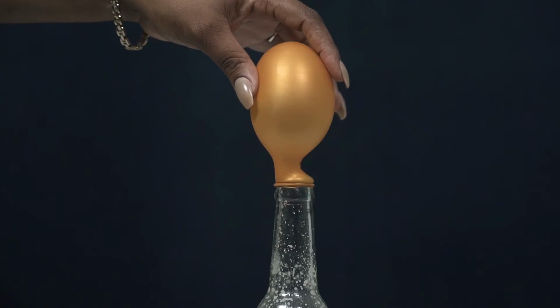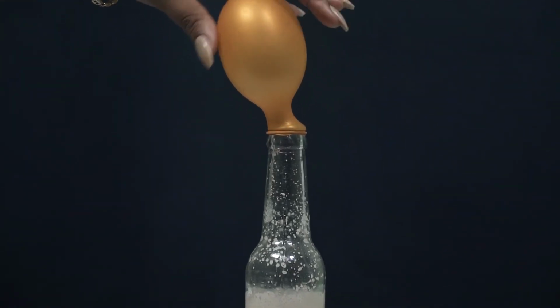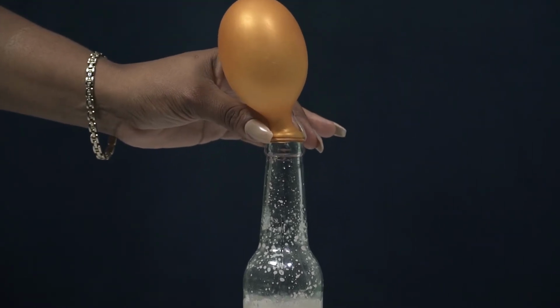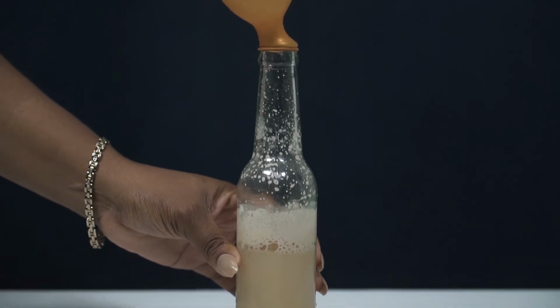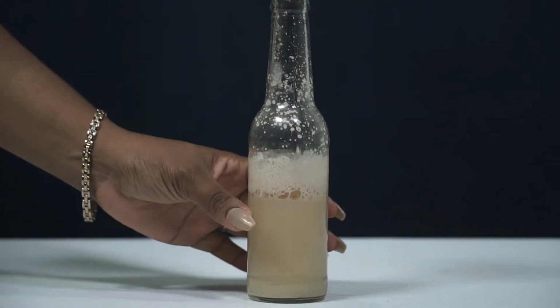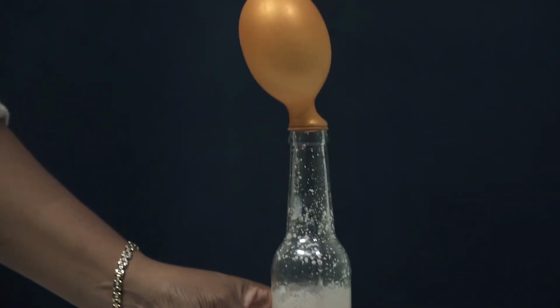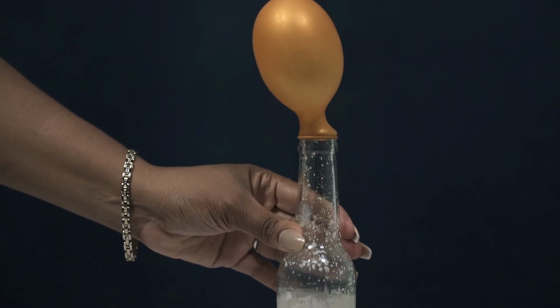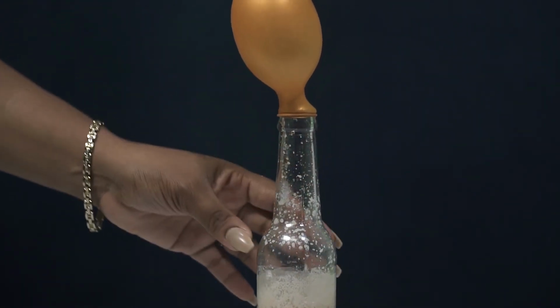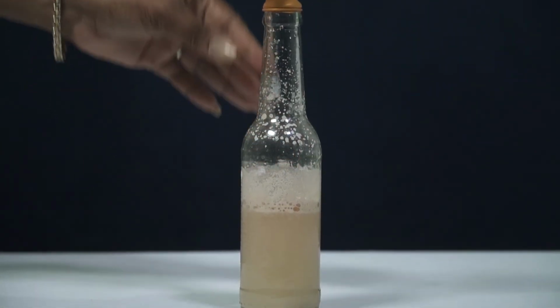So this is the inflated balloon, because the carbon dioxide is trying to escape, so the balloon is now inflated because air is now in this balloon. You can smell the alcohol that is being generated, the ethanol, and you can see in the bottle here, the yeast has utilized the sugar that was placed in it to create carbon dioxide and ethanol, along with its ATP that we are not able to visualize here.